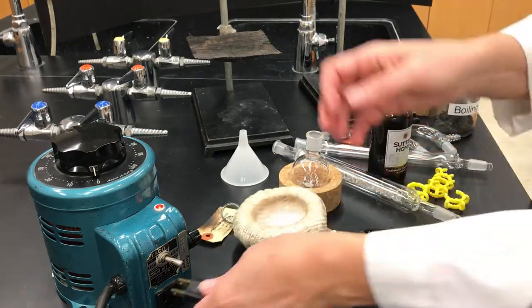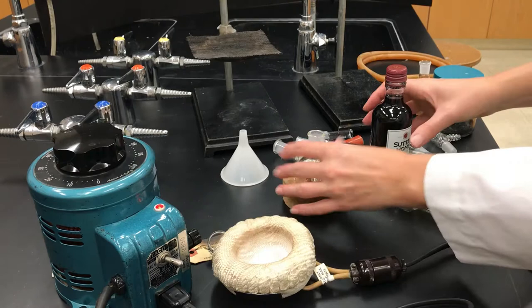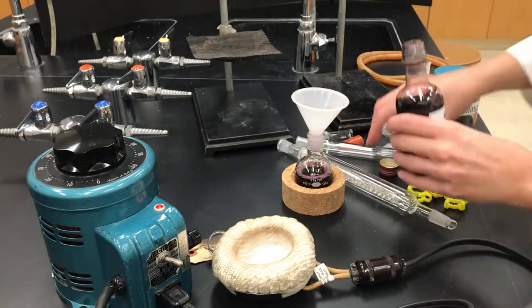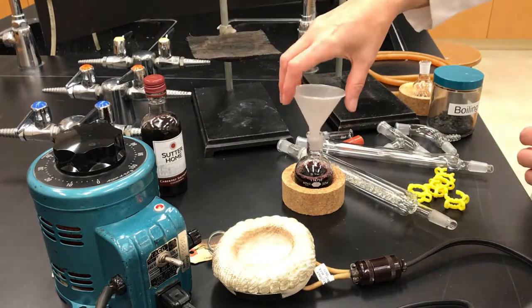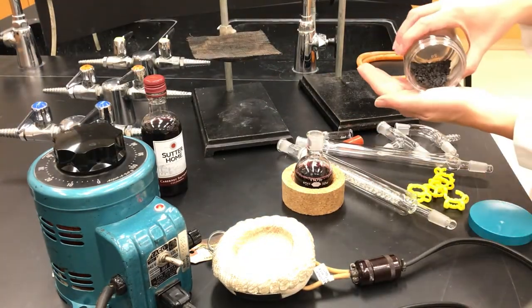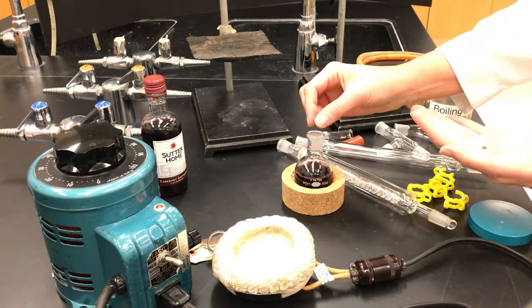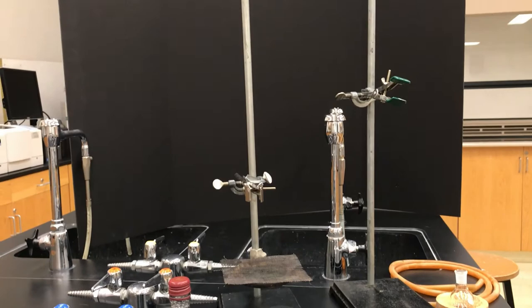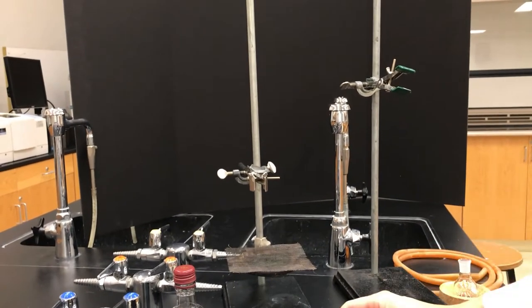So since we're already familiar, why don't we zoom through the setup. You can get your heating mantle preheated, pour some liquid into a round bottom flask that you want to distill, and add a few boiling stones to ensure smooth boiling. Then very importantly, clamp it very securely to a ring stand.